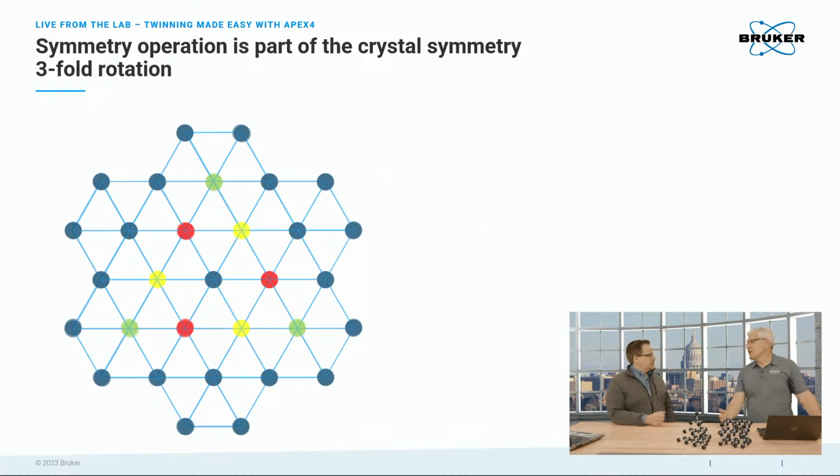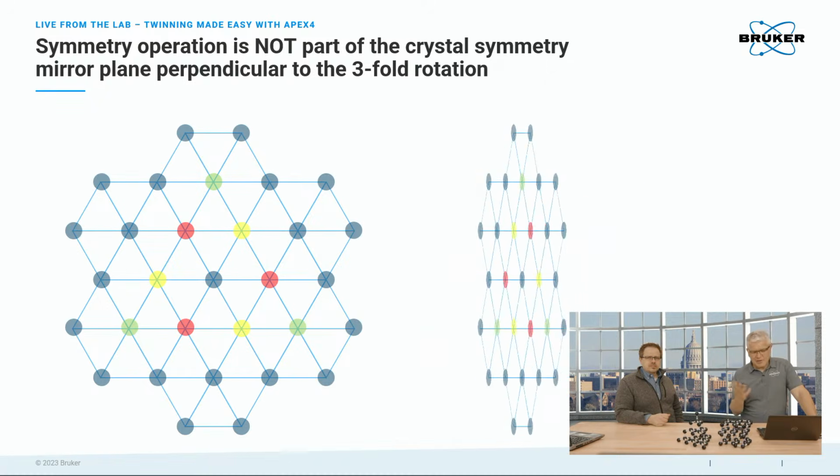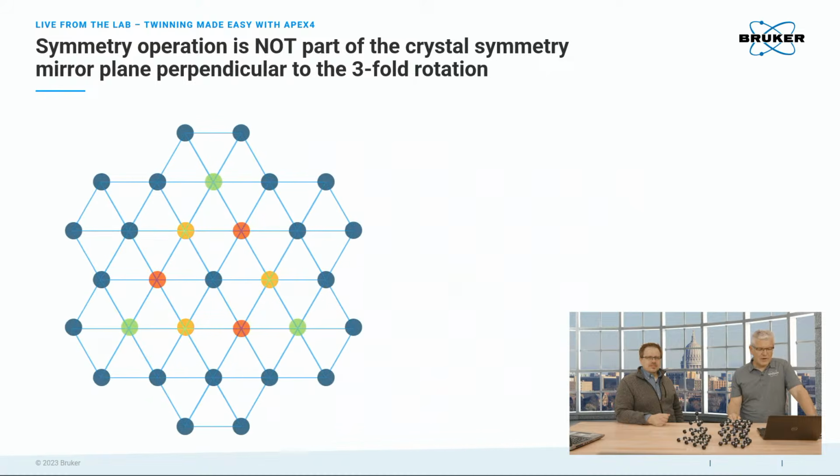Right. So if the symmetry operation is a symmetry operation of the system, it's not a twin. But in the case of the spinel twin, now I'm simulating a mirror plane. And when I overlap those, you see we don't have yellow and red anymore. We get orange. So we get a mixture of the intensities.